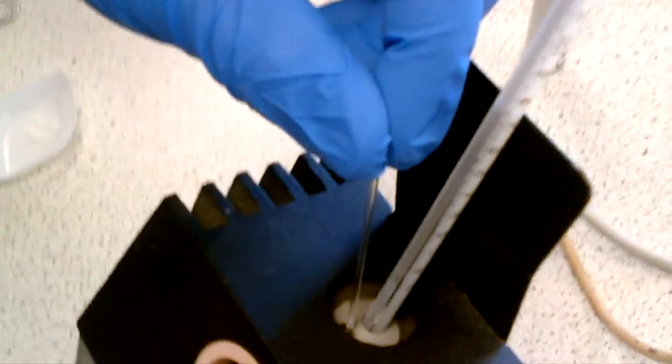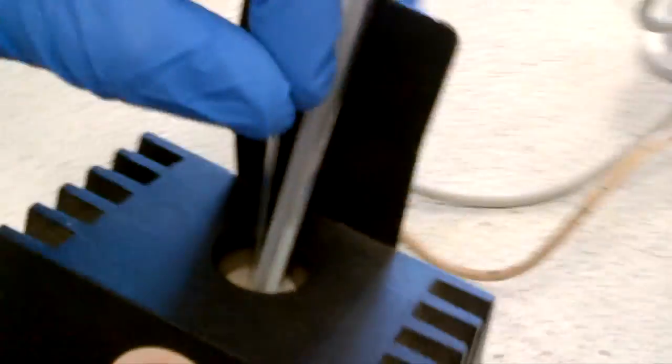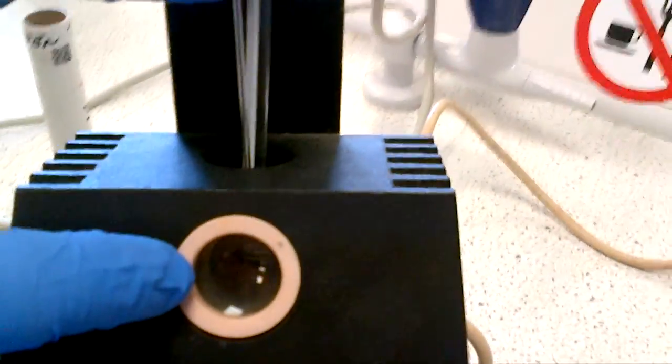So once that's in place, you've got a good depth of sample, you then thread through one of the three apertures, choose bronze, silver, or gold as an Olympic winning position, so I'll go for the gold position, and my trusted cameraman Amjad will point down there now, and we'll see this hopefully pop down. Yes, we'll switch it on, that would help, wouldn't it? So we'll thread down, and it goes into the gold position.